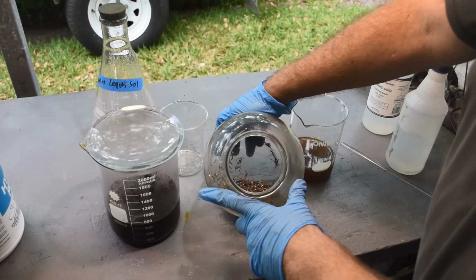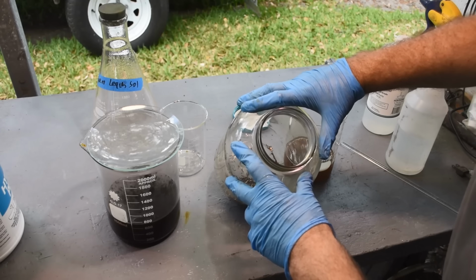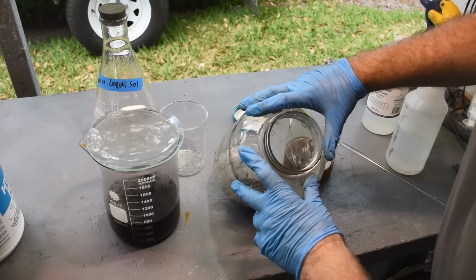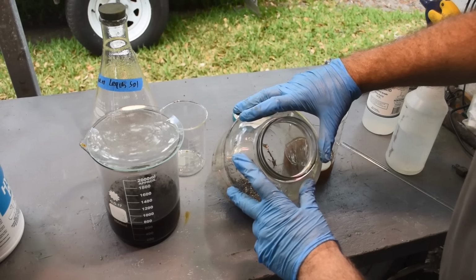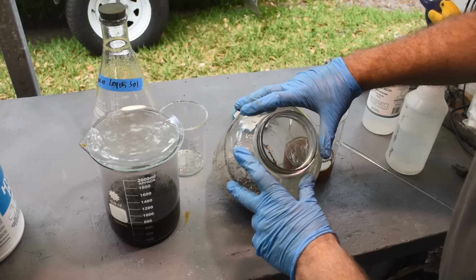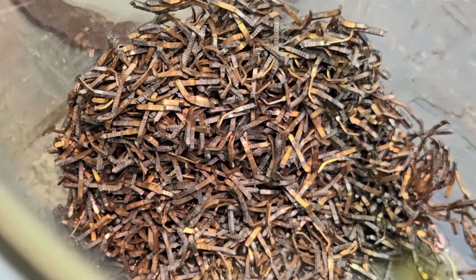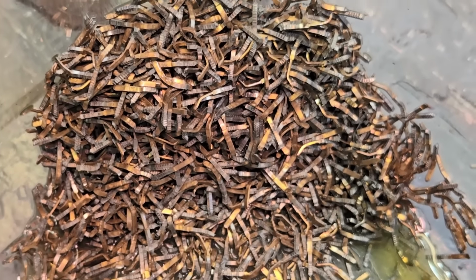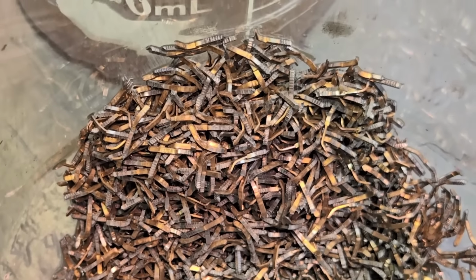And I can see a lot of the gold has been removed from those pins. I don't know if I can give you a good look at it, maybe with my phone. There's still gold there, but a lot of it has been removed. Let me see if I can give you a close-up look at it with my phone, then we'll give it another treatment. All right, so here's as good a shot as I can get you of the pins down in there. A lot of the gold has been removed, but there's still gold there.